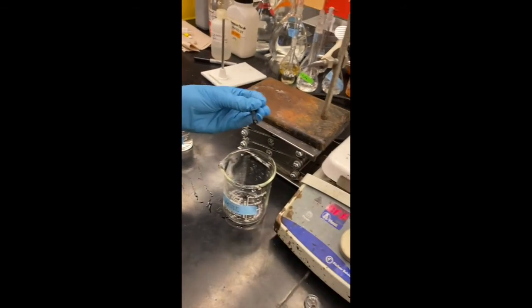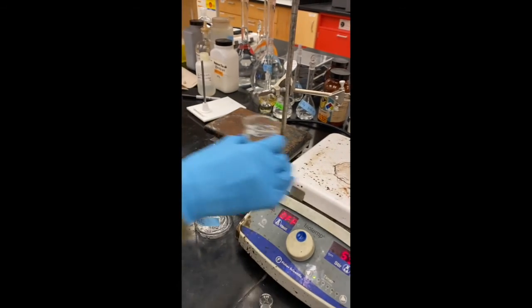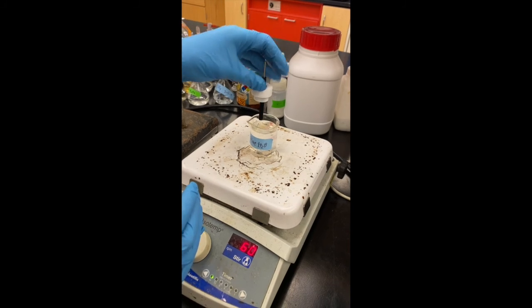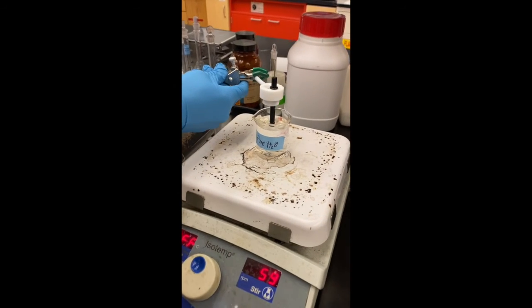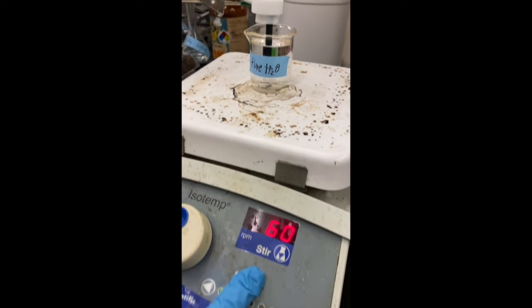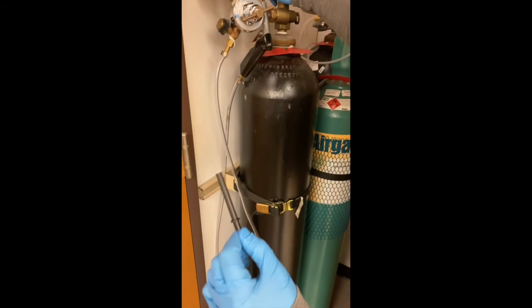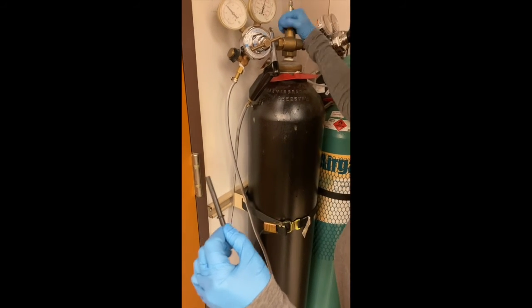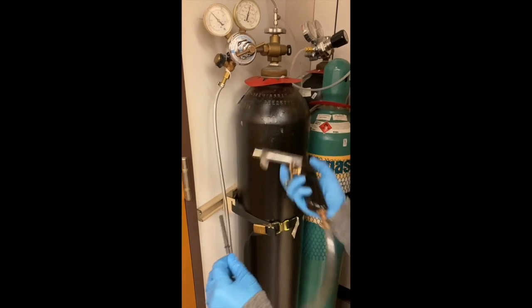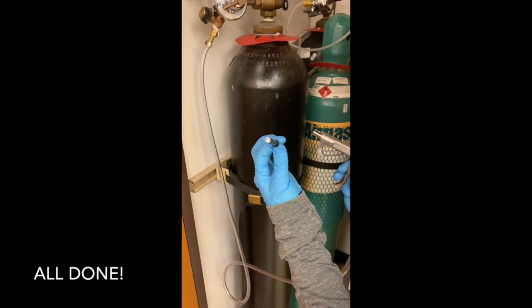And then now, we're going to switch to a solution of just pure water. Now we're going to spin the electrode in the water for about 40 minutes. So I'm going to lower it in here, make sure the tip is immersed, and then I'm going to keep the stir bar at about 60 rotations per minute and leave this for 40 minutes. And the final step here is to dry the electrode with nitrogen gas, like we did earlier. Now you are ready to test.